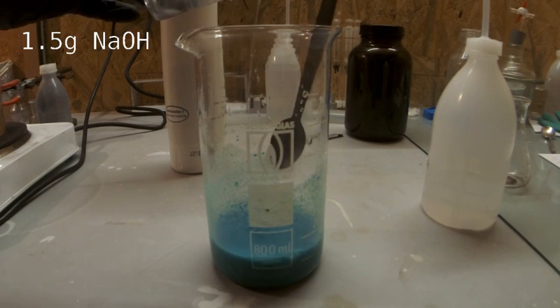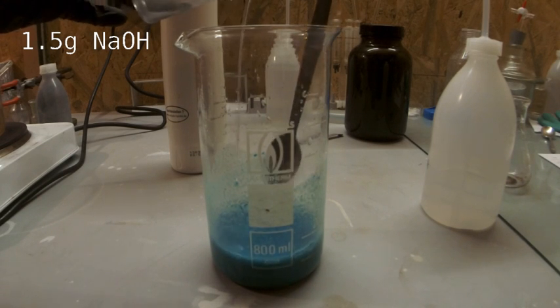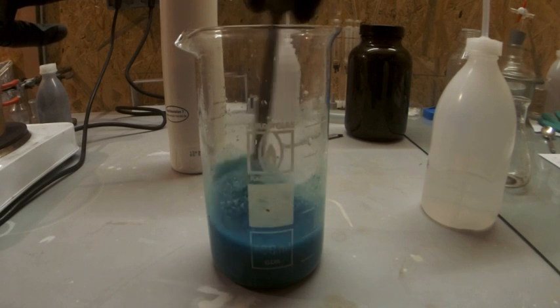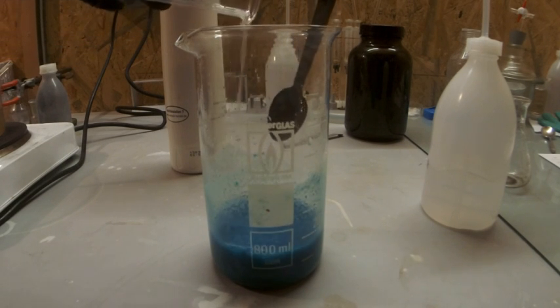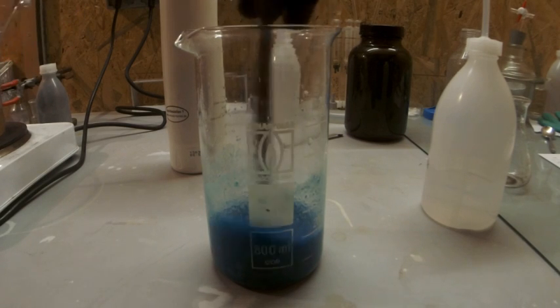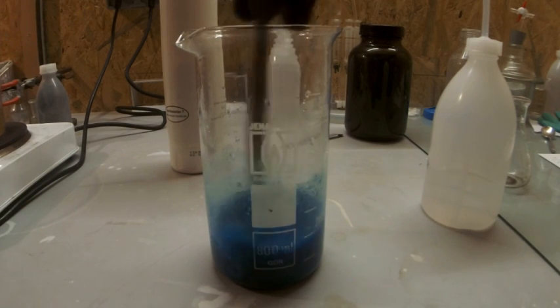So now back to this rather simple synthesis. When you mix the solutions, swirl them around and you will immediately see copper hydroxide precipitating out. I added the sodium hydroxide in two batches, but there is really no use to it.